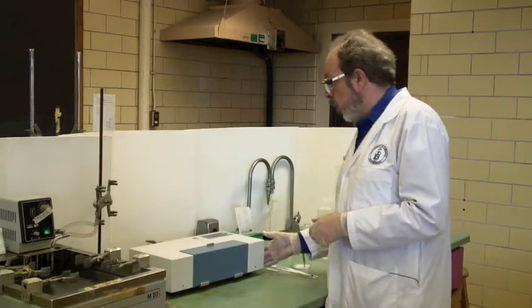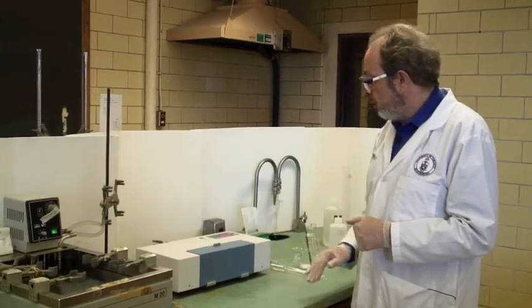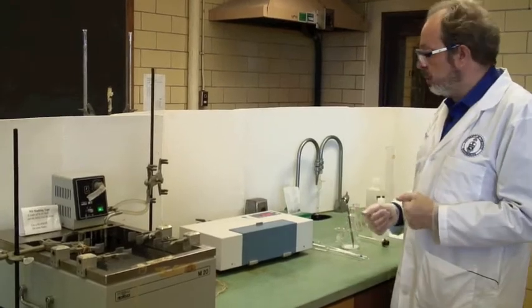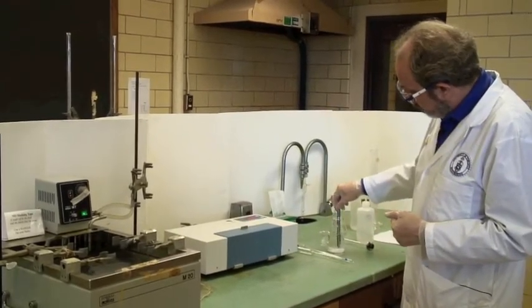This machine is fairly simple. It has an on-off switch here which I've just turned on now and you can read it up here. Now it'll probably give me a very funny number to start off with, but that's okay. Let me check how my syrup is going here.